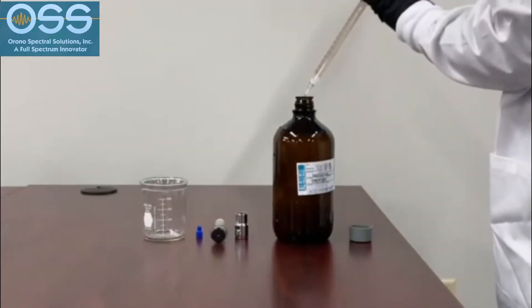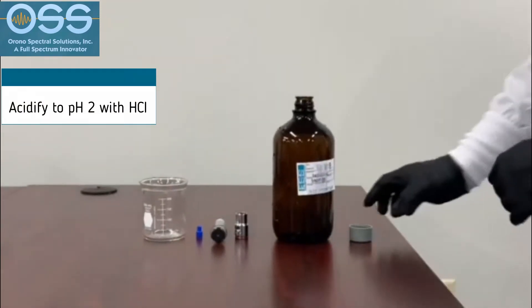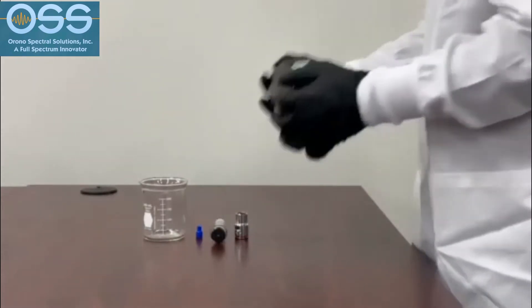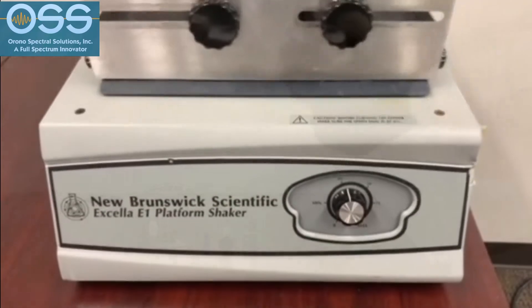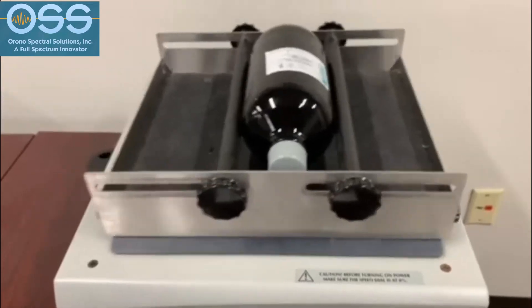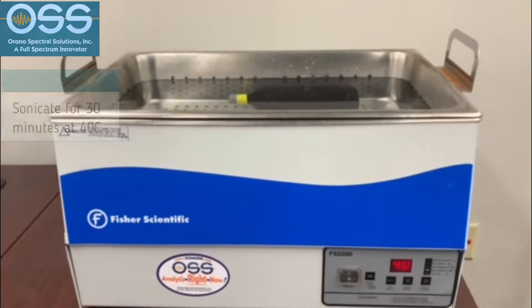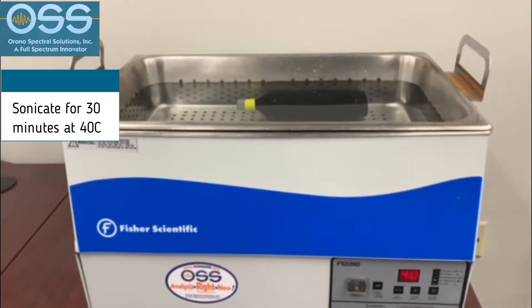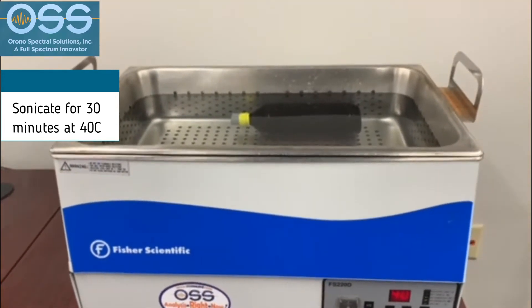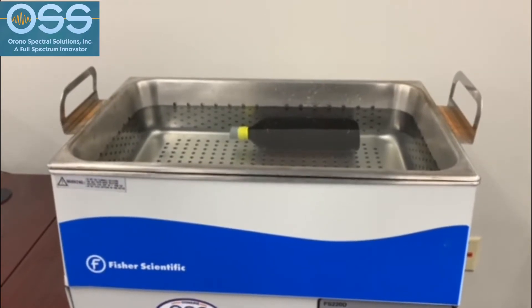Like all oil and water test methods, the first step is to acidify the sample to a pH of 2 using hydrochloric acid. We recommend HCl as other acids may interfere with testing accuracy. Once a pH of 2 has been achieved, the sample is then homogenized first by shaking for 20 minutes using a laboratory shaker, followed by sonication in a sonic water bath at 40 degrees Celsius for 30 minutes. Times may vary depending on the level of material in a sample, and a more exact time and combination can be determined with your specific sample system.